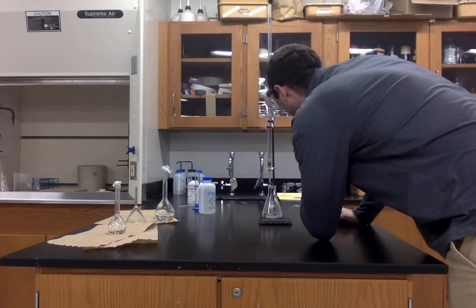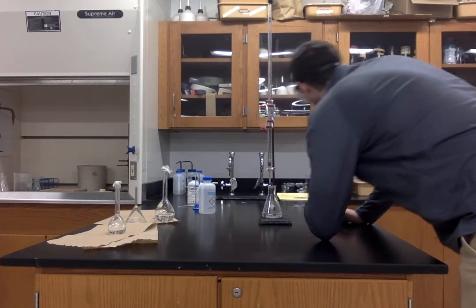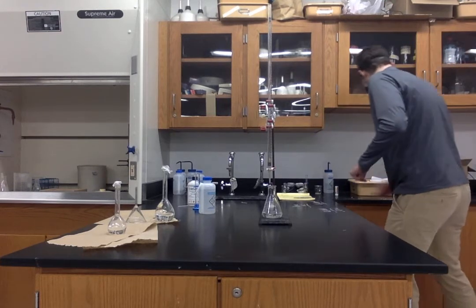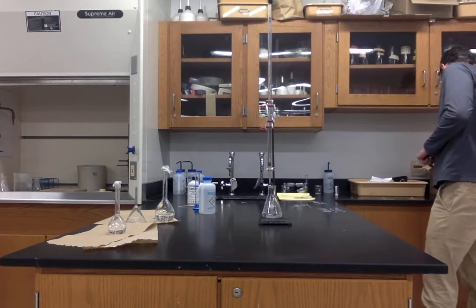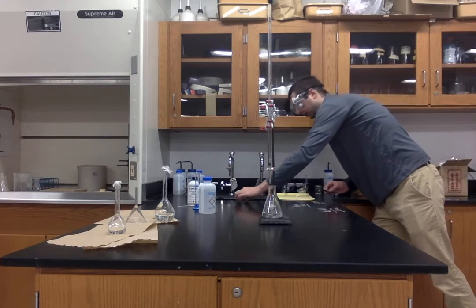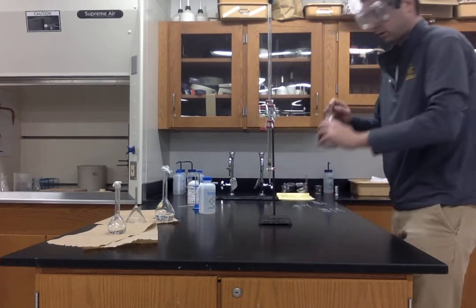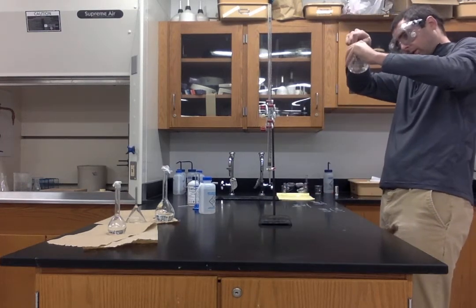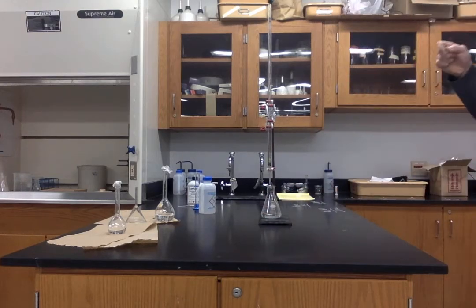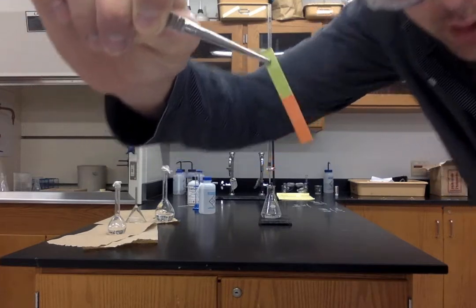So we are at 31.30. 31.30, so that was almost 10 milliliters. Okay. This one will be fairly noticeably different. Okay.